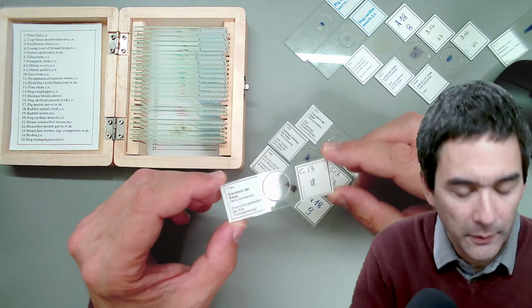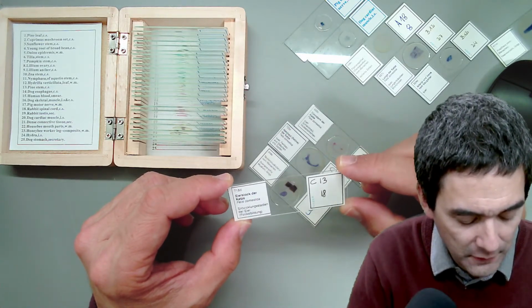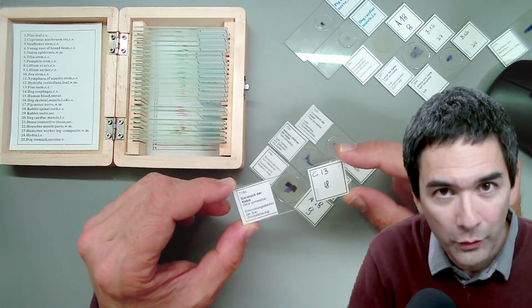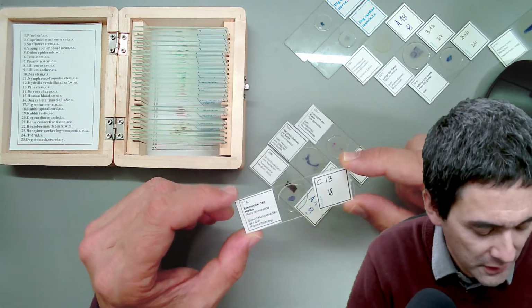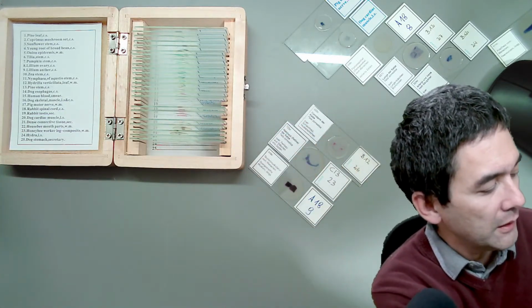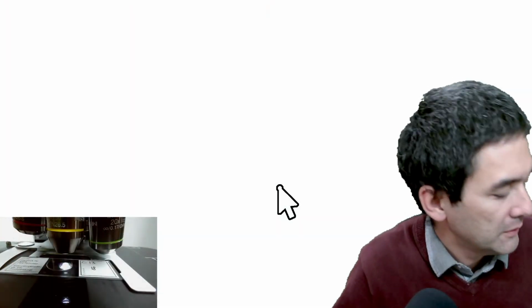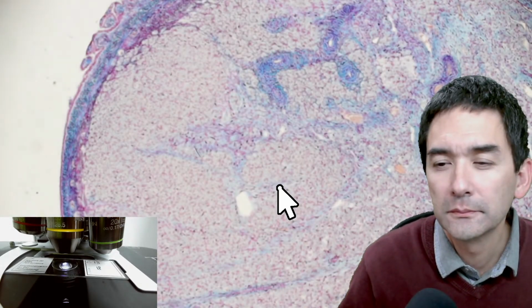I'm not quite happy with this specimen here because the follicle is the part in the ovary that makes the egg cell. I've seen better specimens. I'm just going to show you anyway. Ovaries in a female cat. The ovaries are those parts that produce egg cells. But again, I'm not so super happy with this one over here.